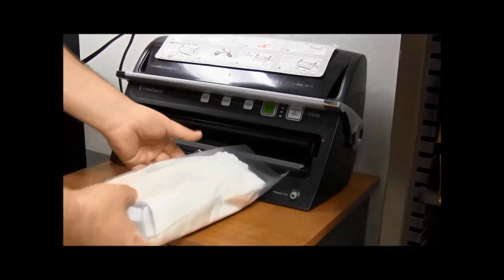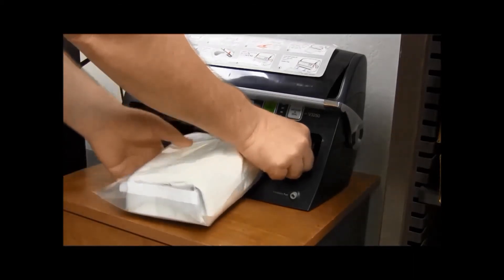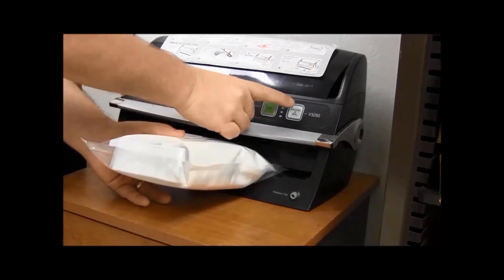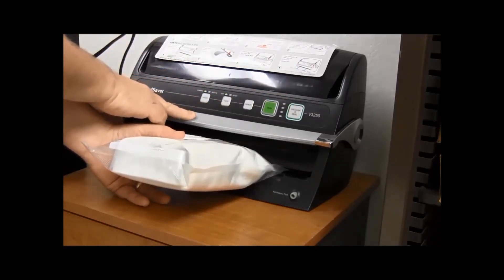But basically you do this for another step. You can do the vacuum seal again or you can just heat seal it.